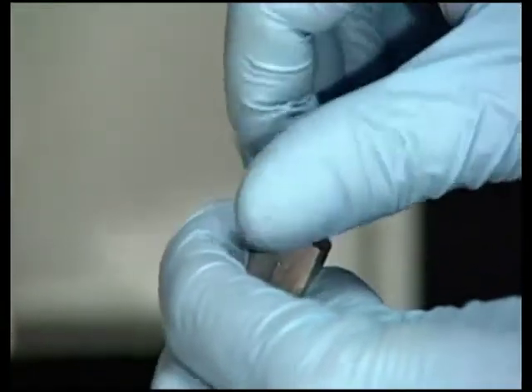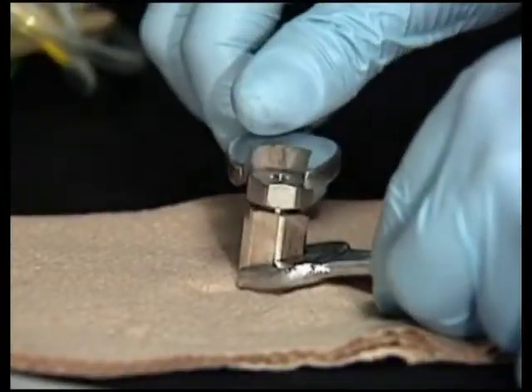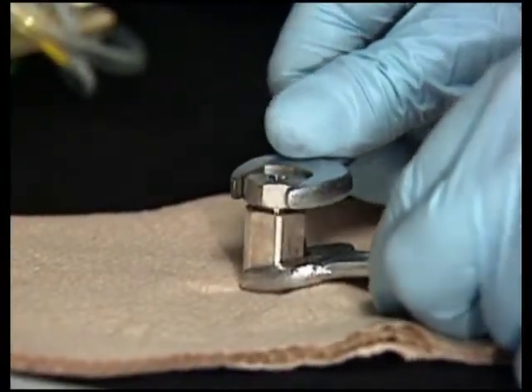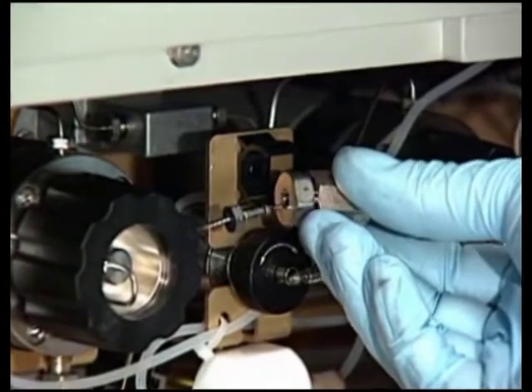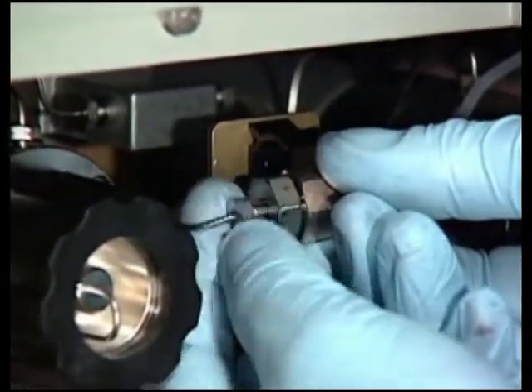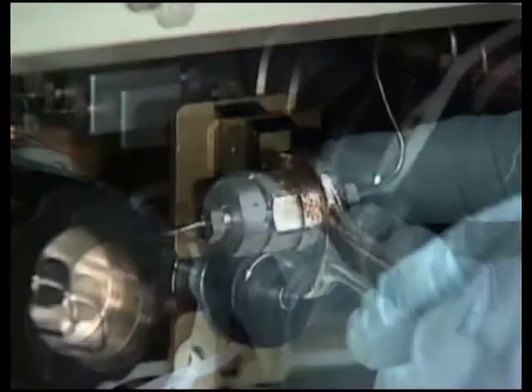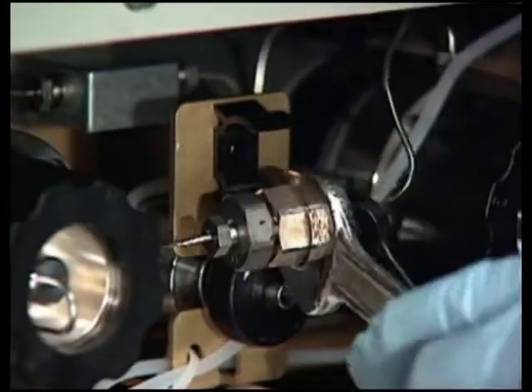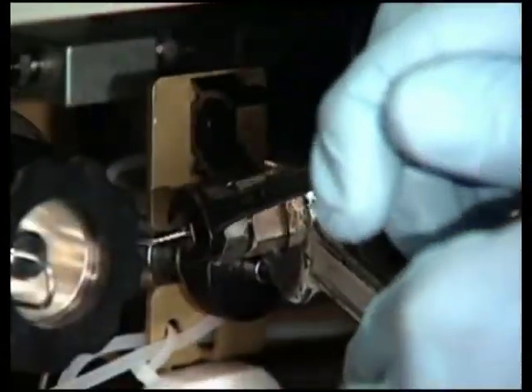Assemble and tighten the two housings together using 5/8-inch wrenches. Position the inlet side of the inline filter toward the left and connect the inlet and outlet tubing to the inline filter assembly. Tighten using the 5/16-inch and 5/8-inch wrenches.